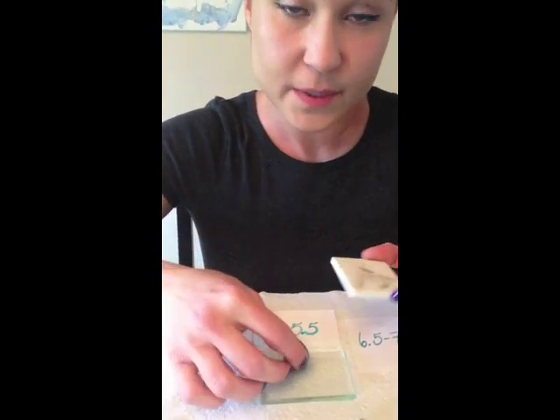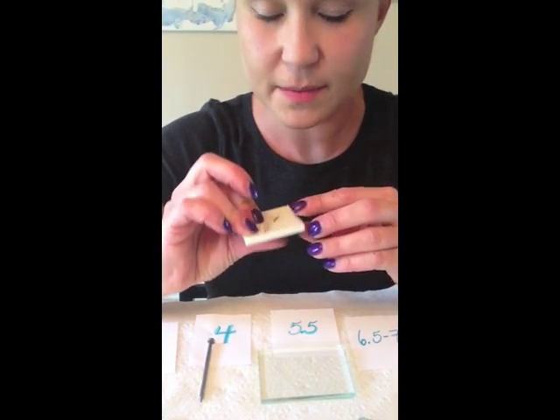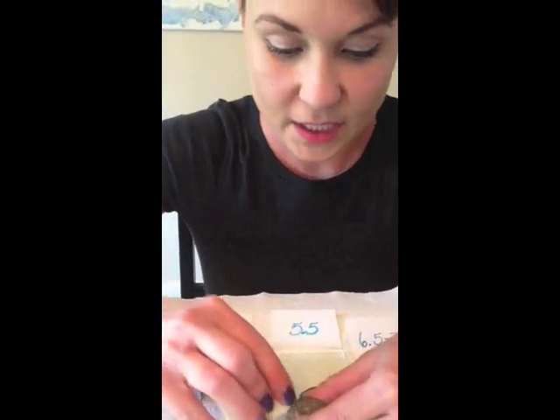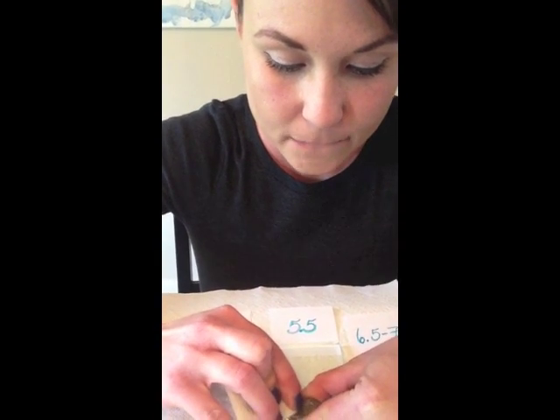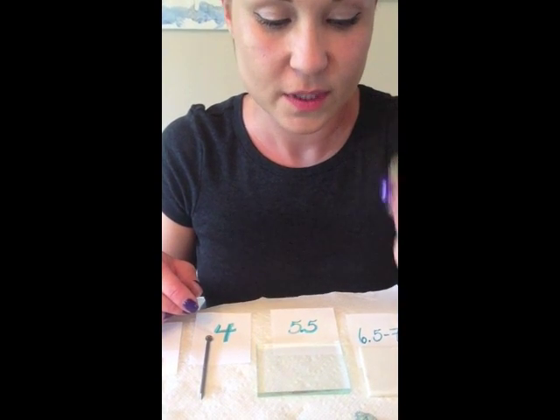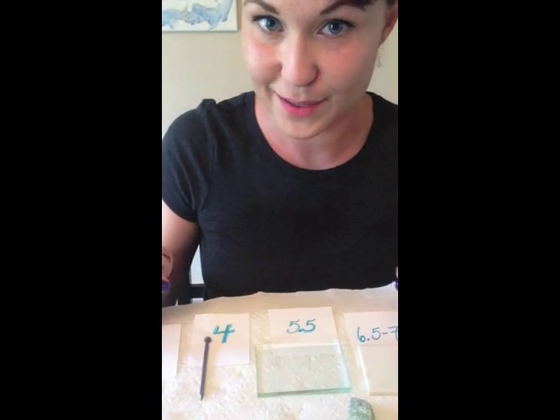Then the streak plate — well, it definitely leaves a streak. But sometimes it can be really difficult to tell if you actually scratch the streak plate, so trying the streak plate on it is always good. The streak plate does scratch it. So you know that this also is less than a six and a half to a seven, so it's probably around a six.